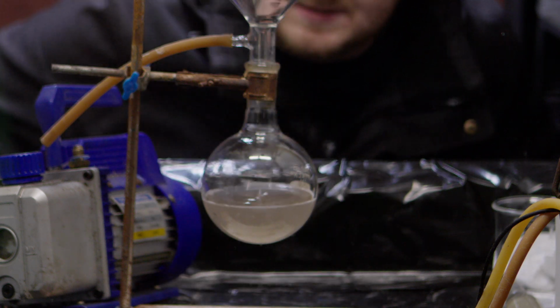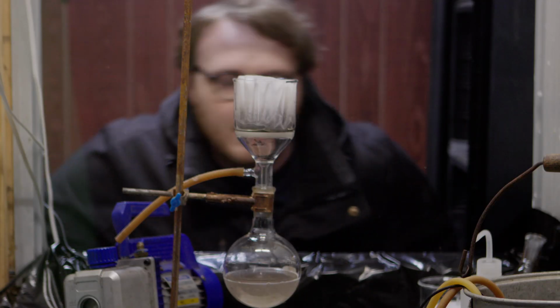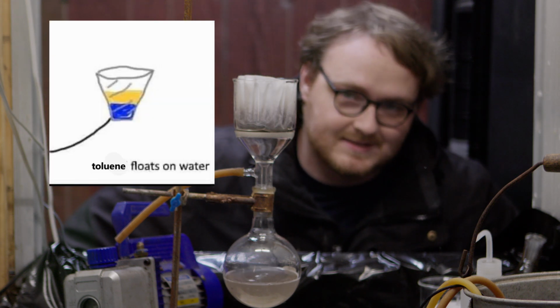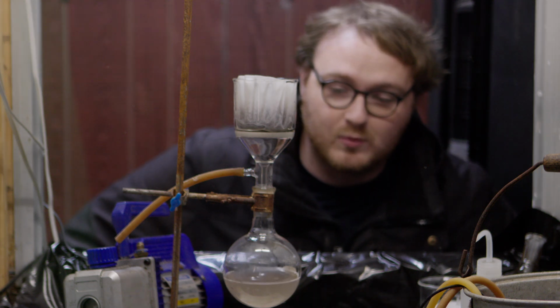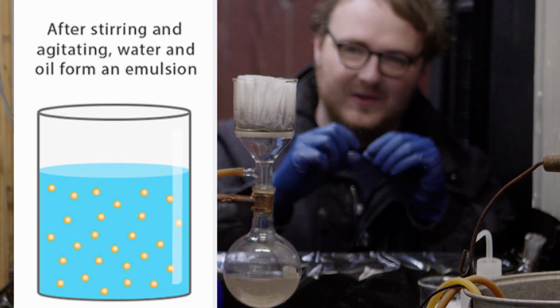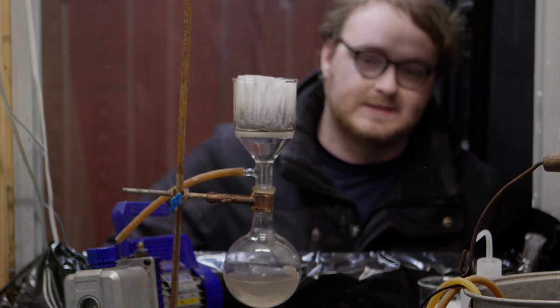And that means that it's thoroughly mixed in, which you may know, toluene and water don't usually mix. Usually toluene floats on water because it's less dense and it's very nonpolar, but if you really mess up, you can get an emulsion, which is basically where you get little droplets of toluene sort of floating around in the water, and they don't like to separate.